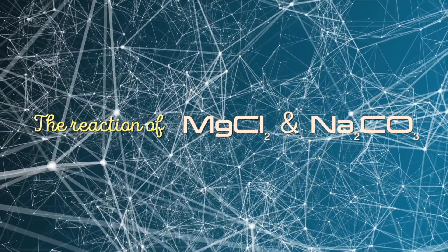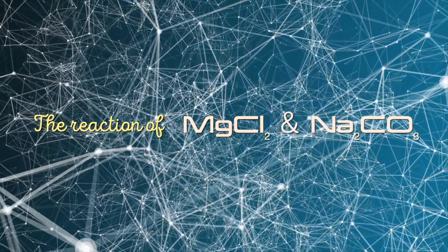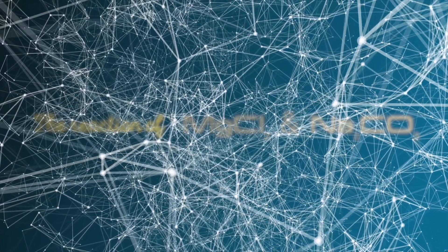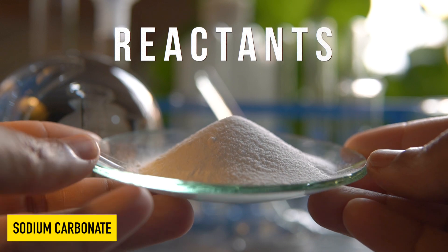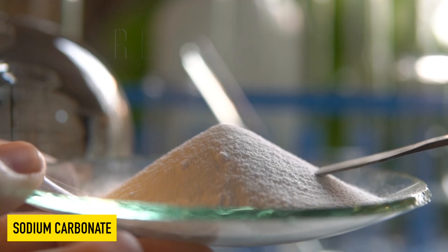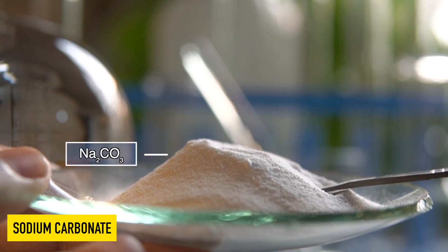Today we are going to observe the chemical reaction between magnesium chloride and sodium carbonate. This is sodium carbonate, a white powdery substance.